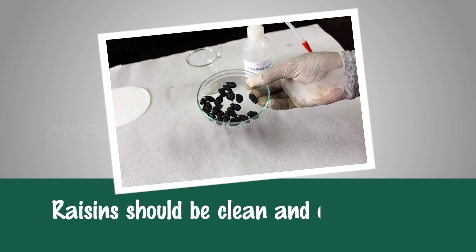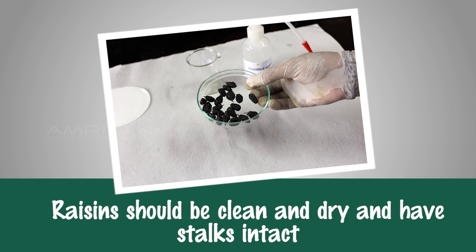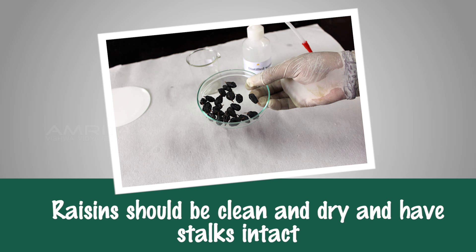Precautions: Raisins should be clean and dry and have their stalks intact.